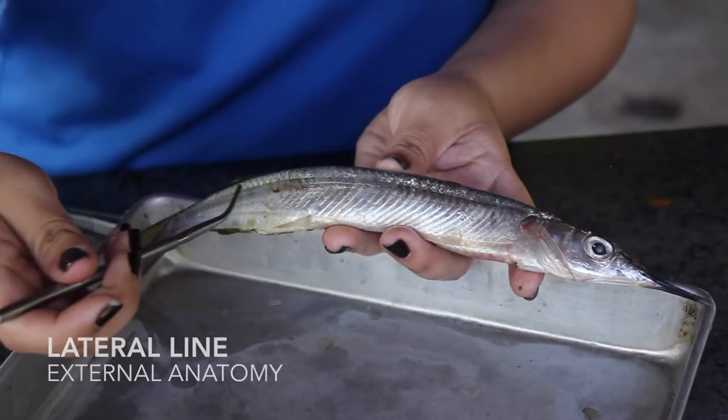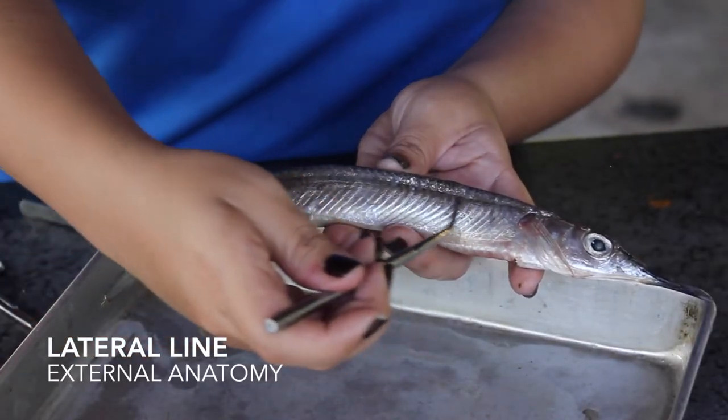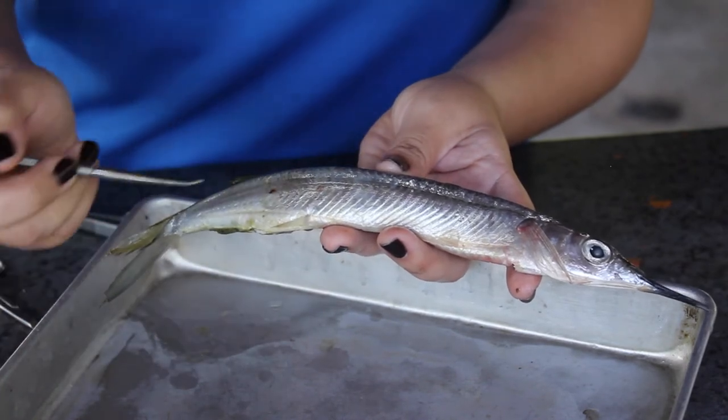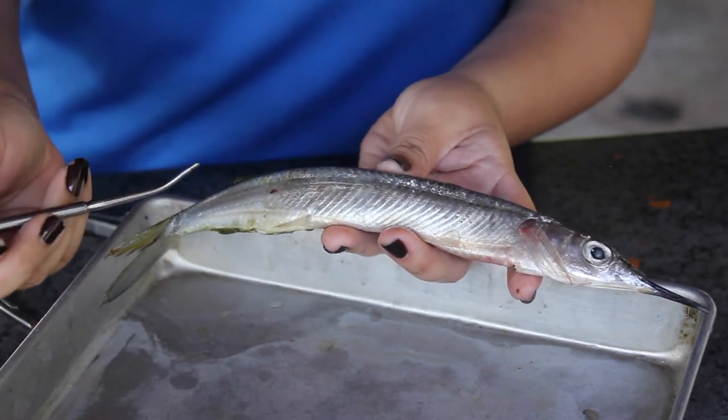This external feature is the lateral line. All fish have these and they use it for schooling. Through this lateral line, they can feel the vibrations of other fish around them.